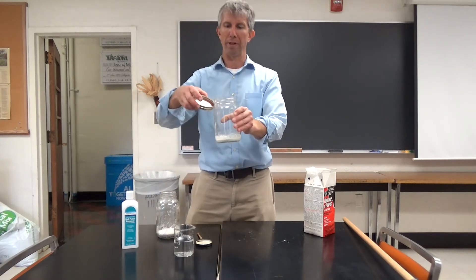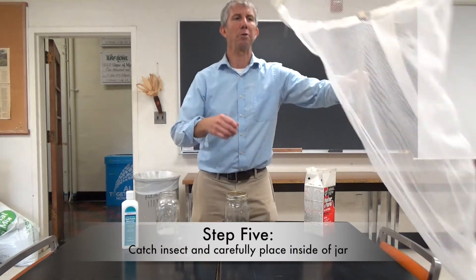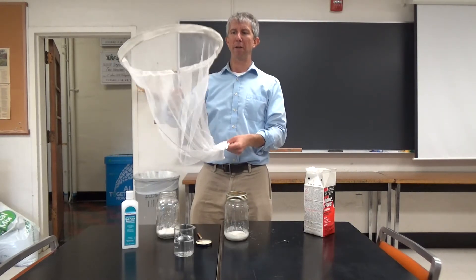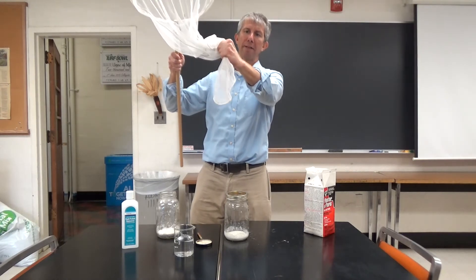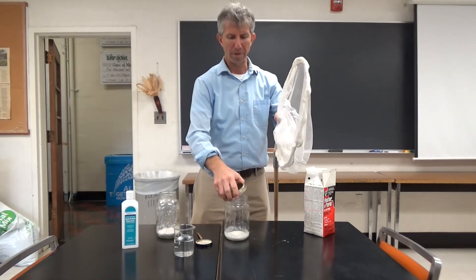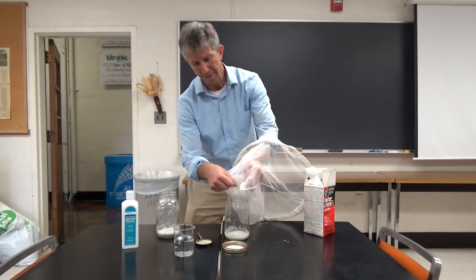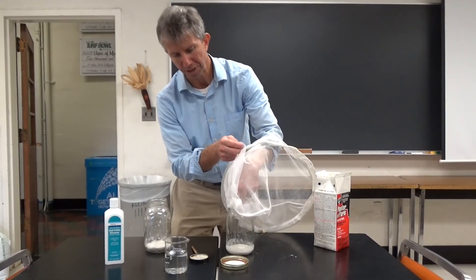After this, you want to go ahead and put the lid on top like that. Taking a look at how you transfer the insect from the net into the jar — you've got your aerial net, and assuming you've got an insect in the bottom of the net, caught so that it can't get out, you would take the jar, open the kill jar, and then feed the net slowly into the kill jar so that the insect doesn't have a chance to escape.